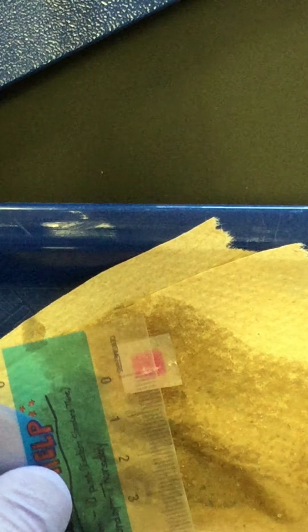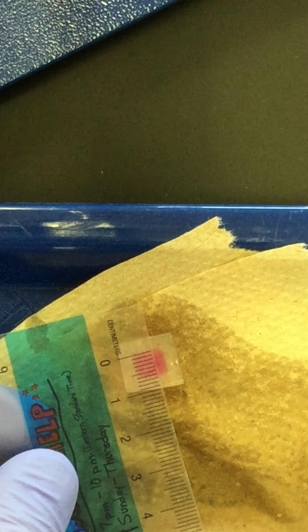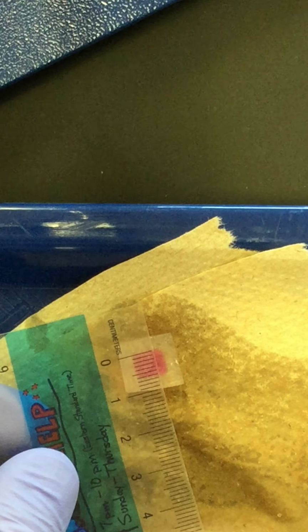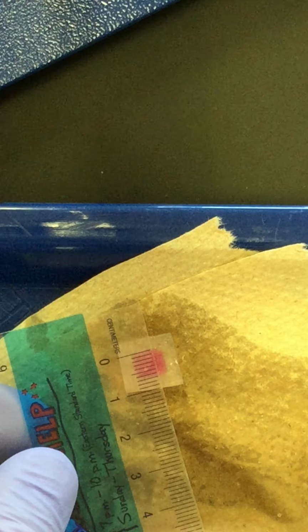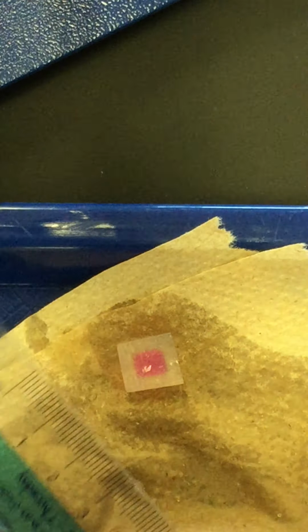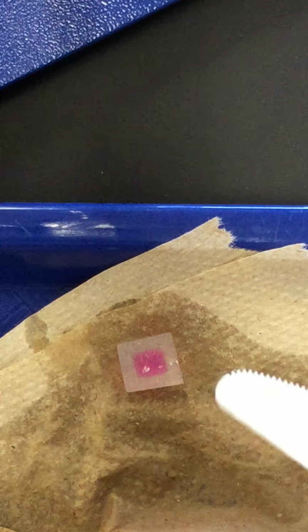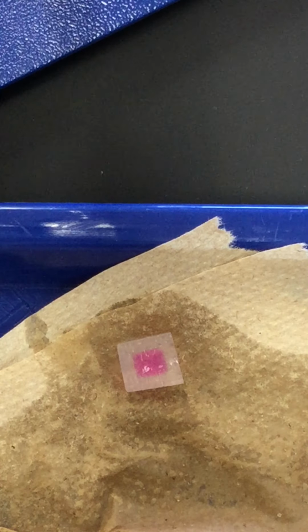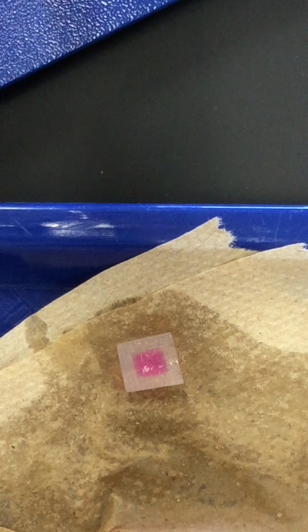Here's the Y value. And the Z value, that is the vertical component, I'd like you to take the average of those two numbers. So X plus Y divided by 2 will give you Z, and then multiply X, Y, Z to get the volume of the cube that's still pink.